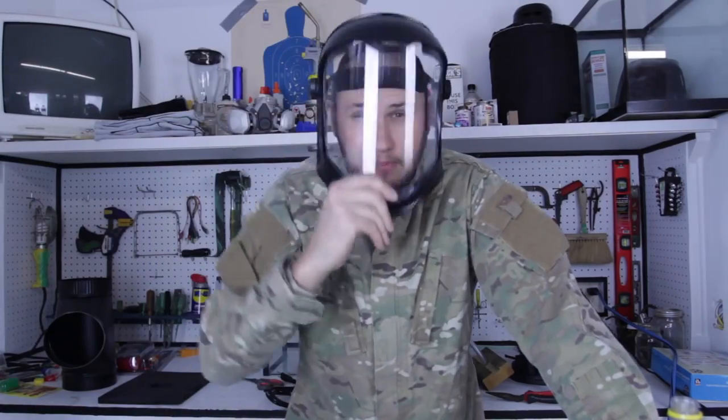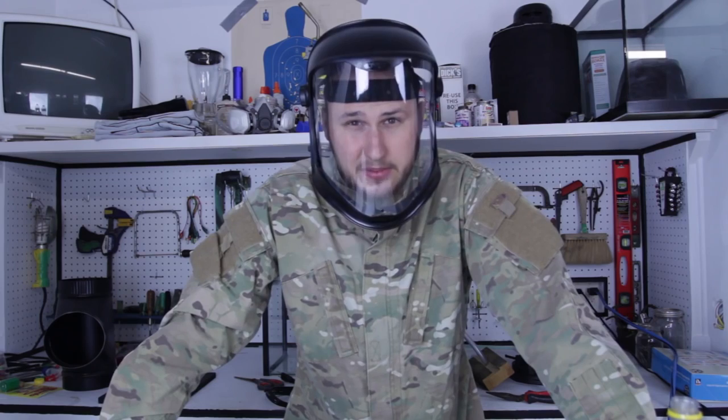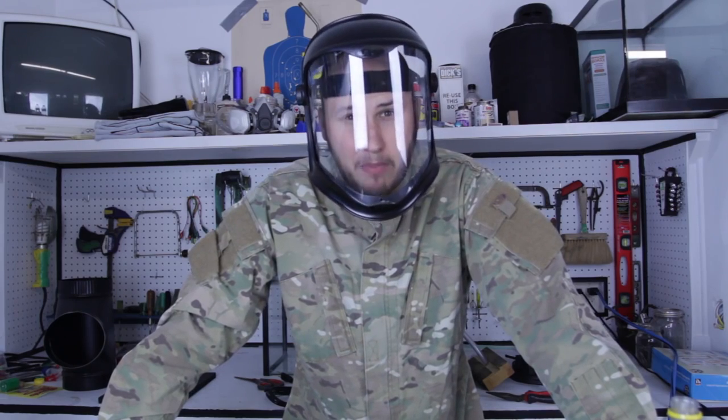What's up, everybody? Welcome back to my laboratory, where safety is number one priority. In this experiment, I'm going to do flaming bubbles. Do not try this at home.